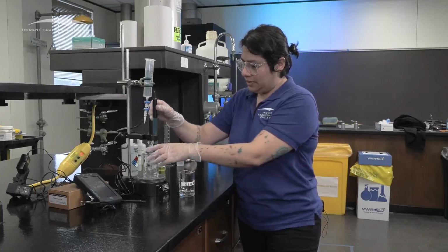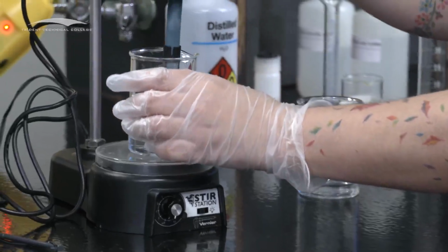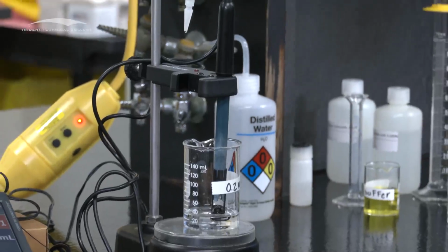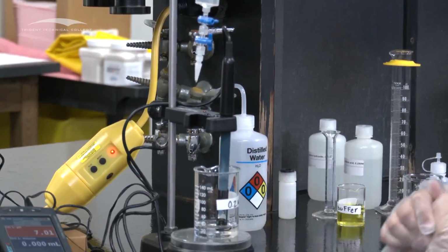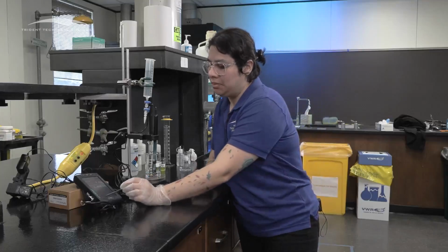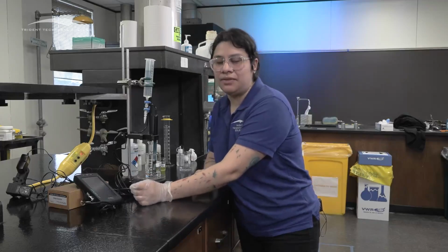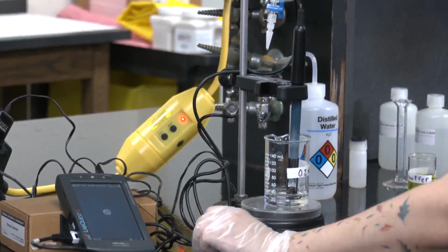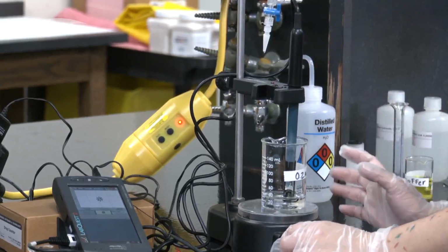And then I'm going to change this beaker that has just the water in it and the waste for this beaker. And then we can start our titration. Make sure that you have a really good flow rate. And then as soon as you're ready, not as soon as you start titration, you got to do this before you start titration. You're going to hit play, which is the lower button. And if it gives you a warning, just say discard. And then it will think it's normal, it does that.